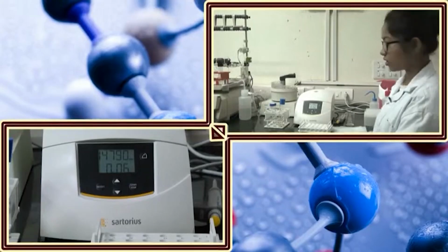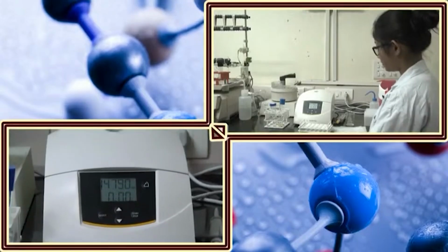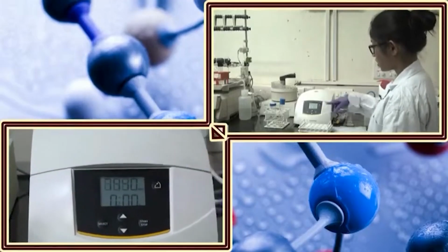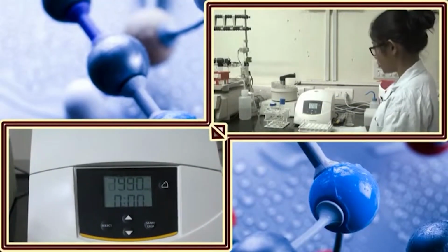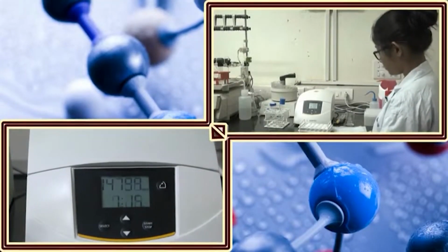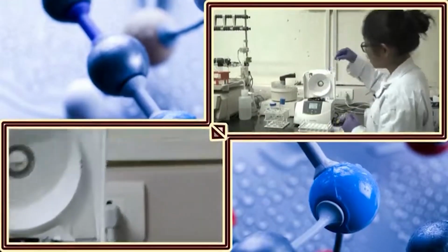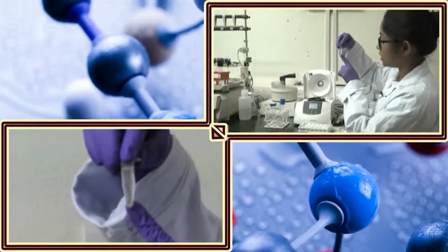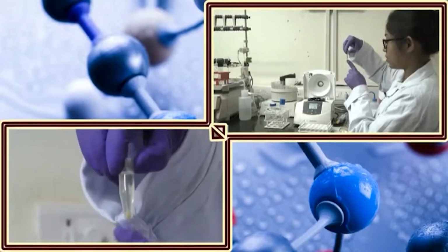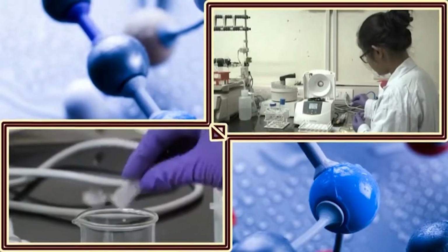So, my second round of centrifugation is also over. It will stop on its own. Now you can see the RPM value is going down, that means it has been stopped, and it will gradually stop and the lid will open on its own. Again you can see the upper part of the supernatant is almost clear, like a normal media, and there is a big cell pellet formation at the bottom of the centrifuge tube. Again I will discard the supernatant into this beaker. Do not throw it here and there.